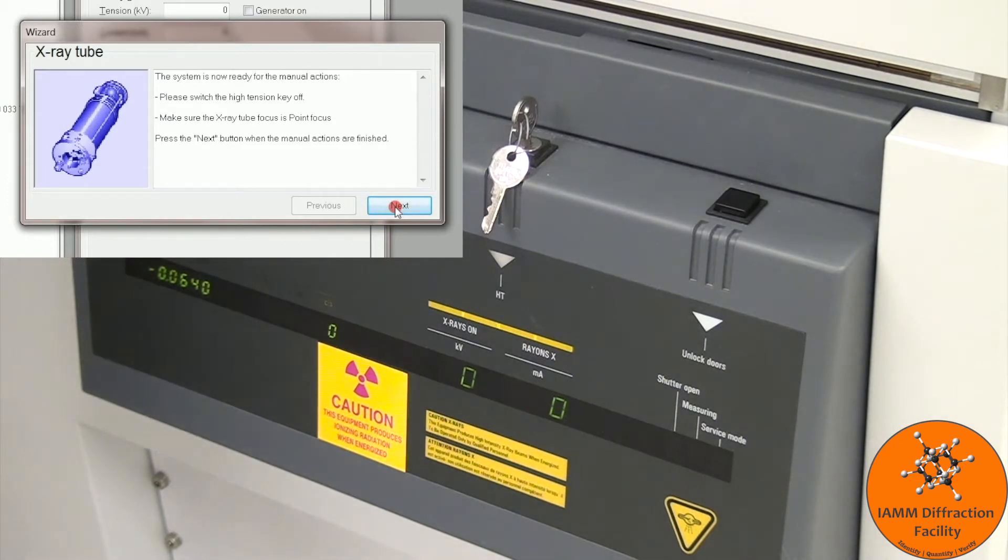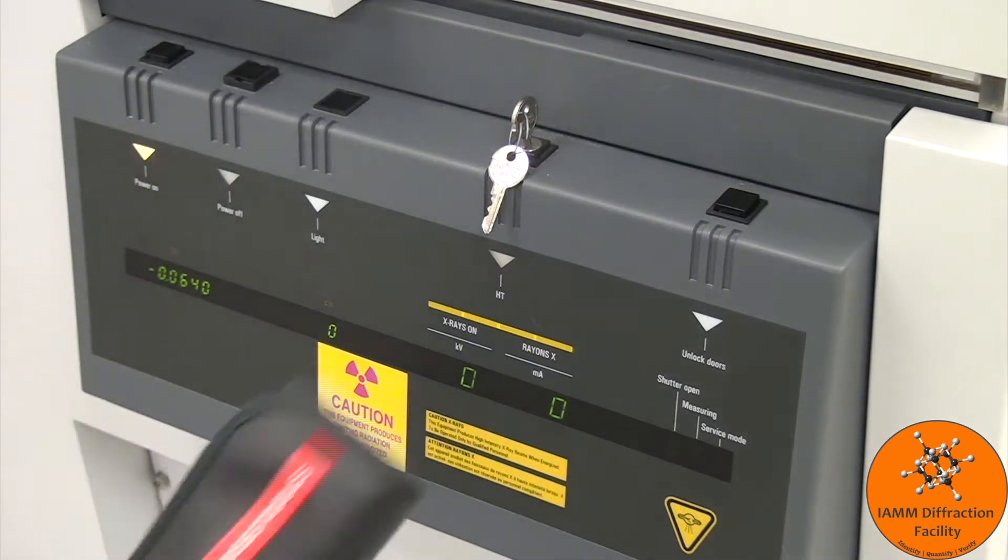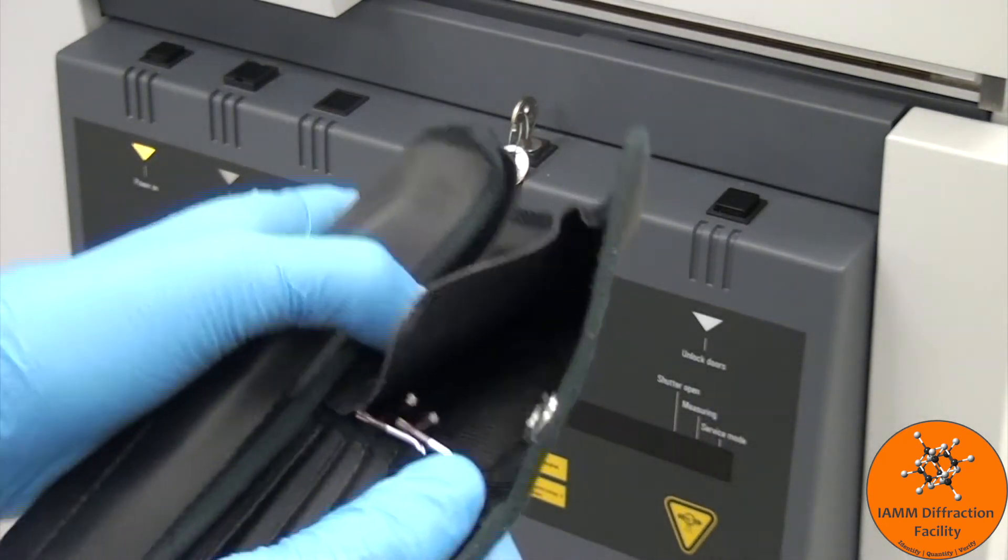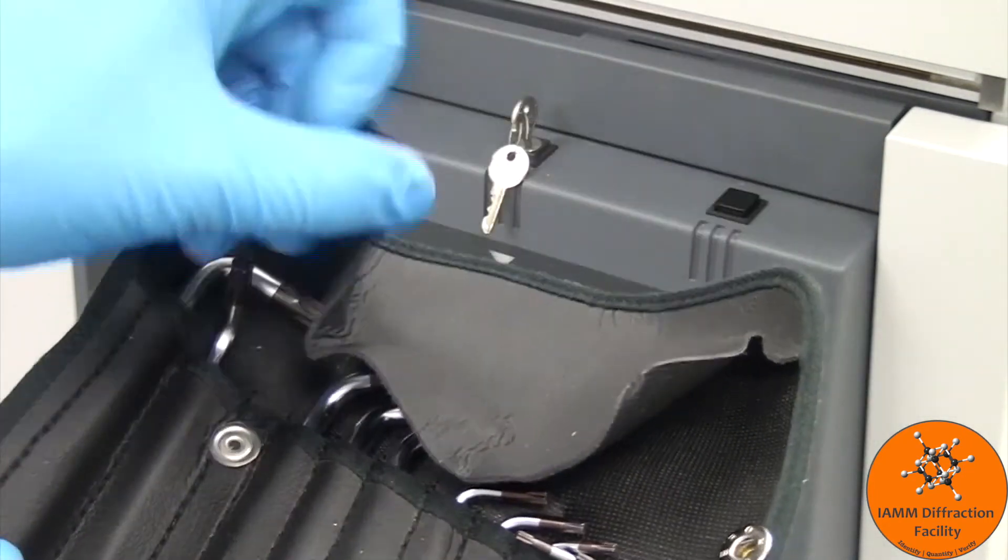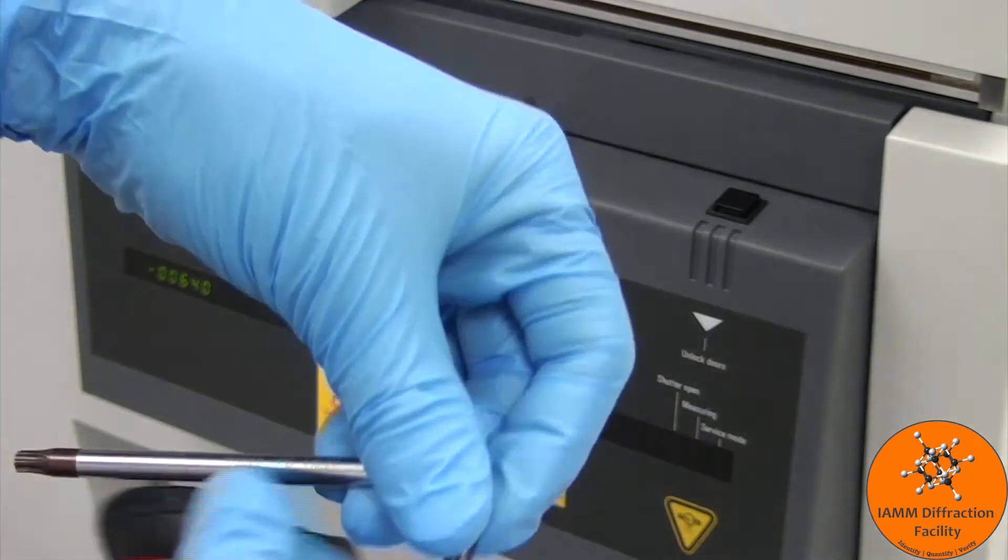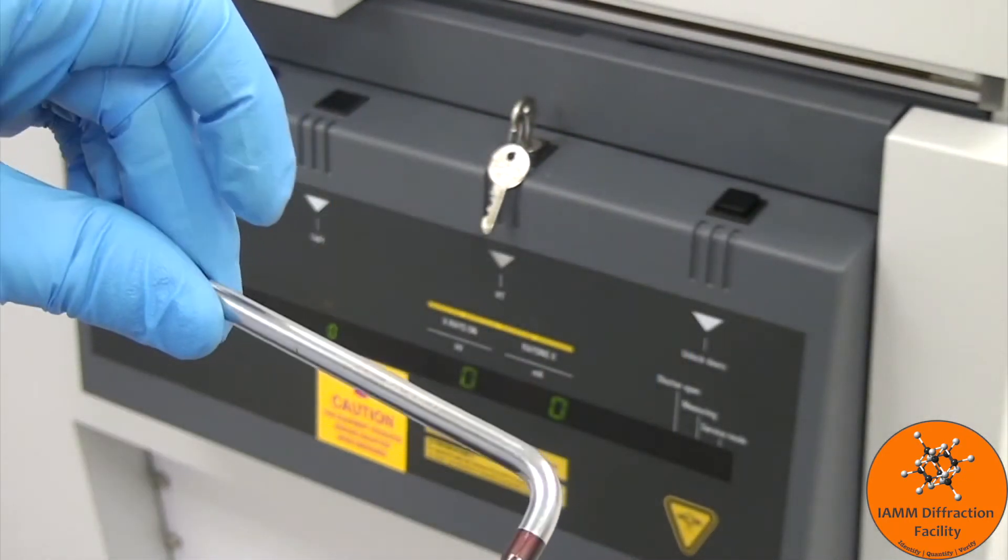Let me grab the needed tools. Hopefully this one. It's the T27. I believe that works well.